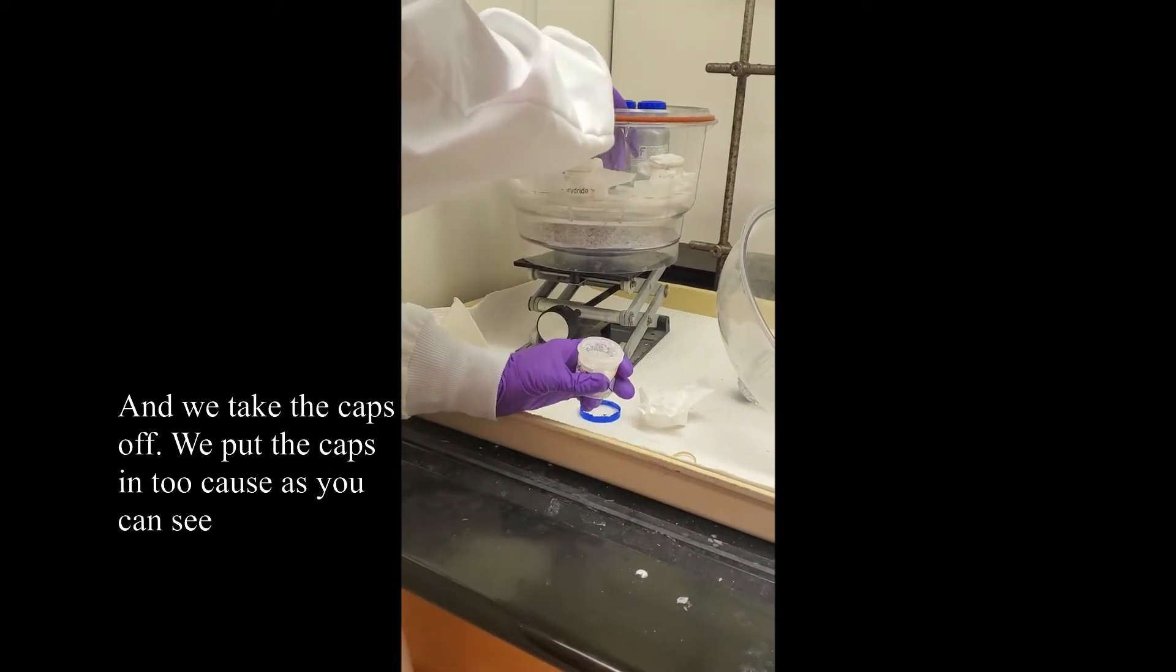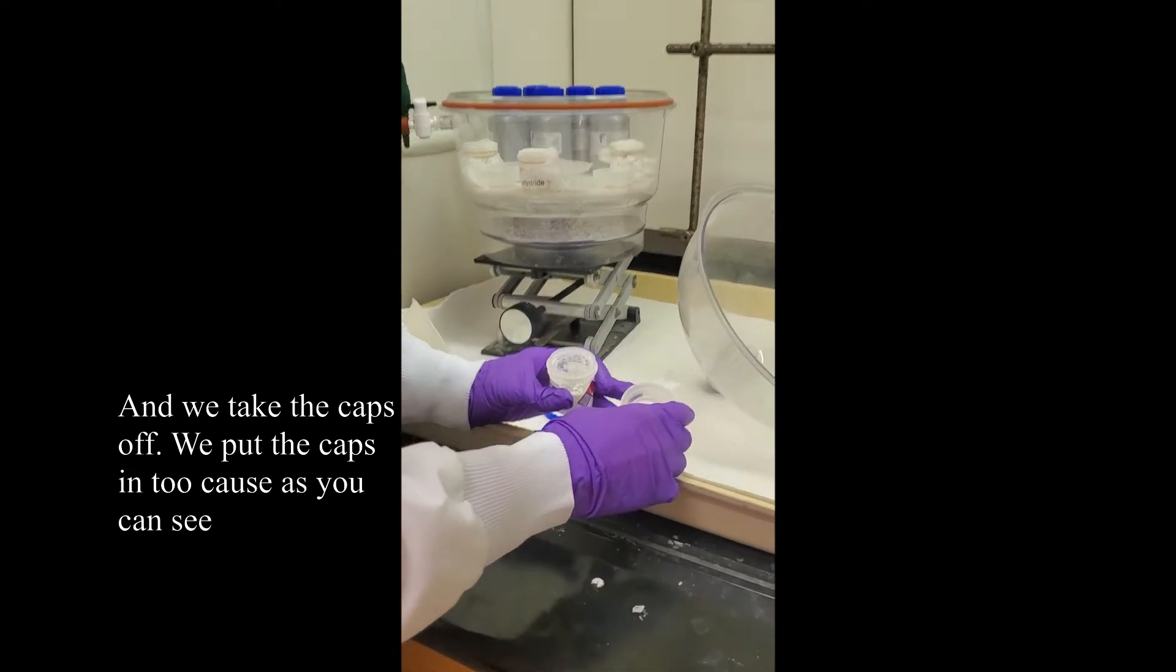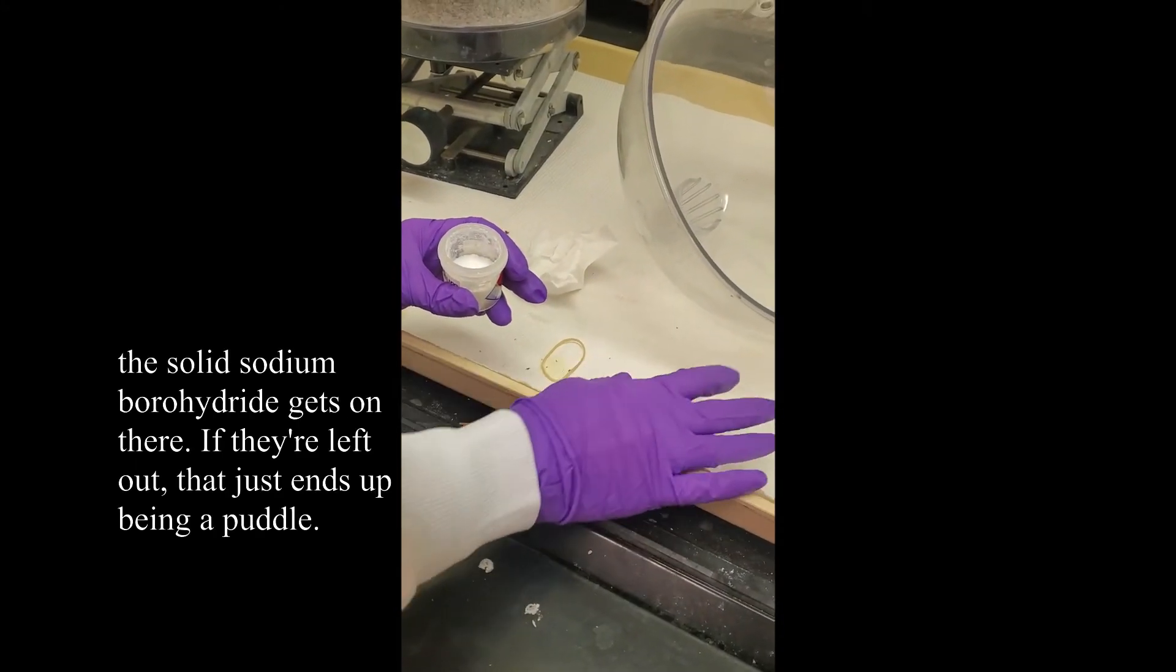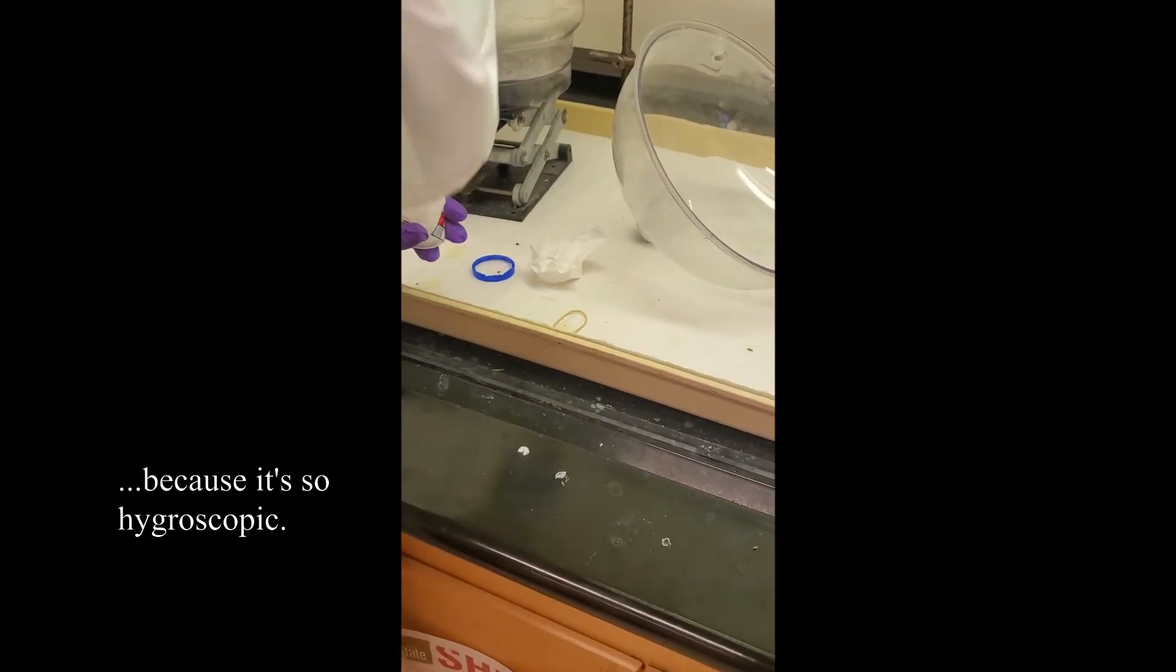And we take the caps off. We put the caps in too, because as you can see, the solid sodium borohydride gets on there. If they're left out, it just ends up being a puddle because it's so hygroscopic.